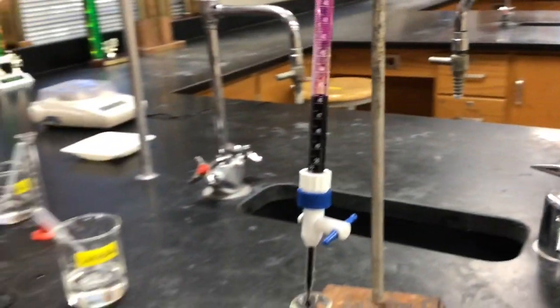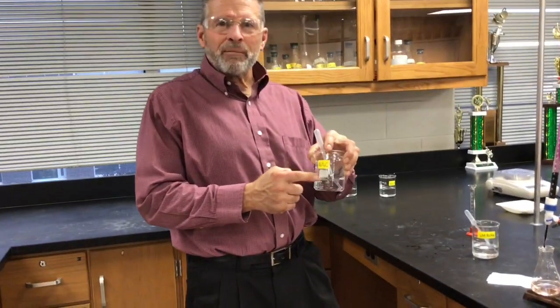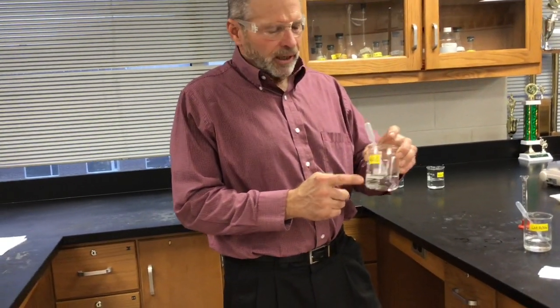All right. I can't remember, did I mention this is sample C? I think we did. Okay, yeah, this is sample C.